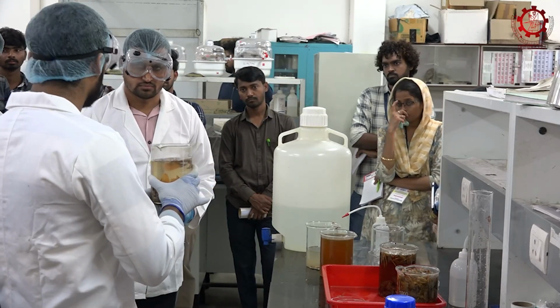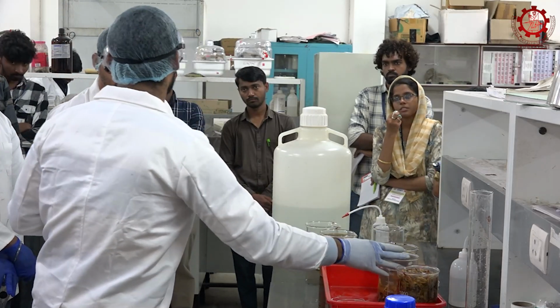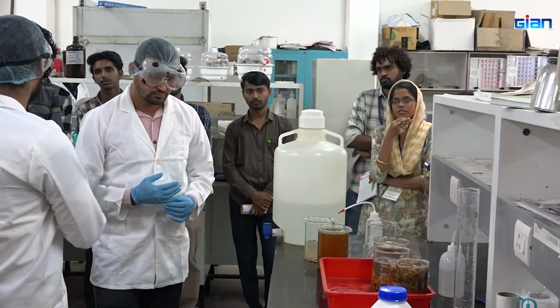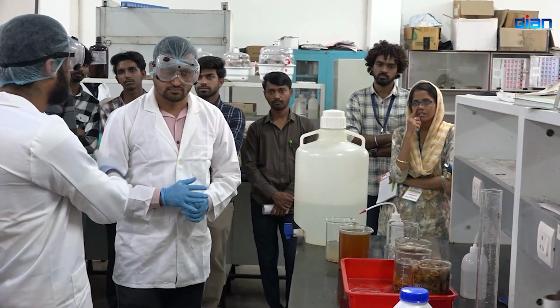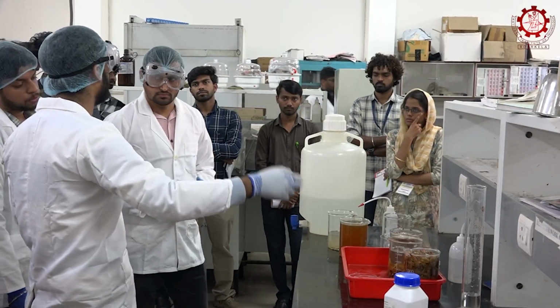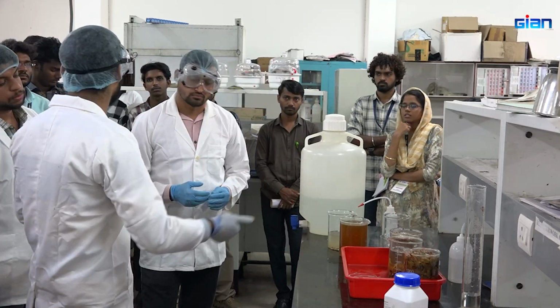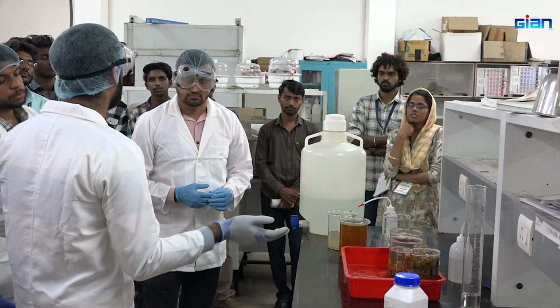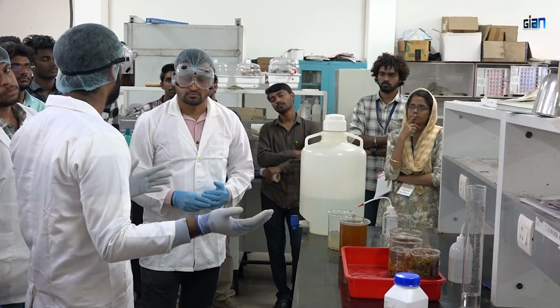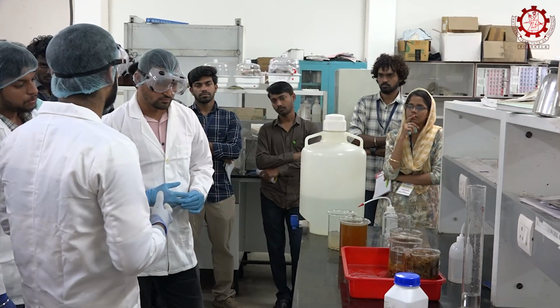Okay, so now we will be keeping it for some 6 to 7 hours, and at night we will be separating it and keeping the liquid fraction for protein collection. To the remaining fraction we will be adding NaOH again, 1 normal, not 0.5, and we will keep it overnight in an incubator at 60 to 70 degrees Celsius. Tomorrow we will be getting, not completely, but up to a level, deacetylation can happen. So we will be getting chitosan.